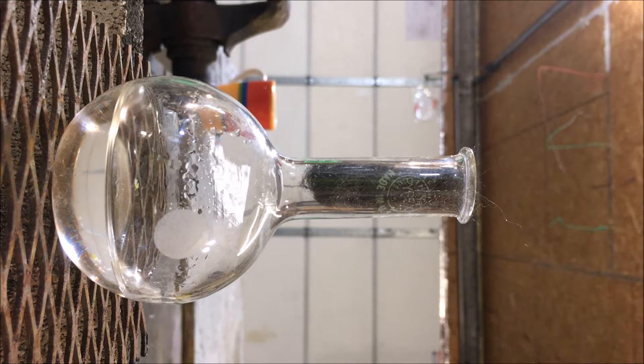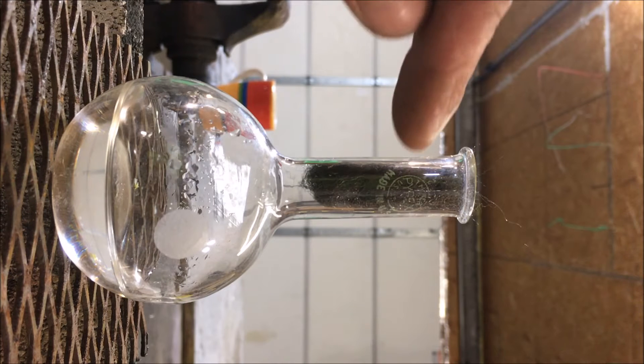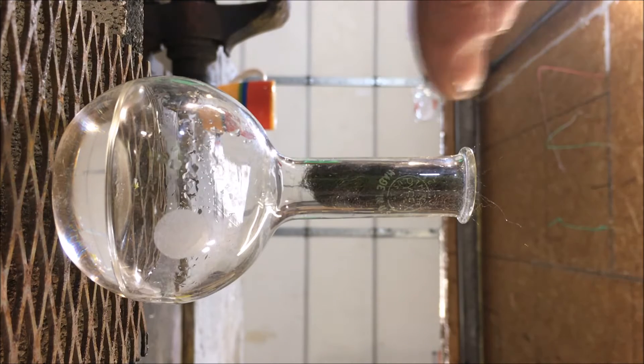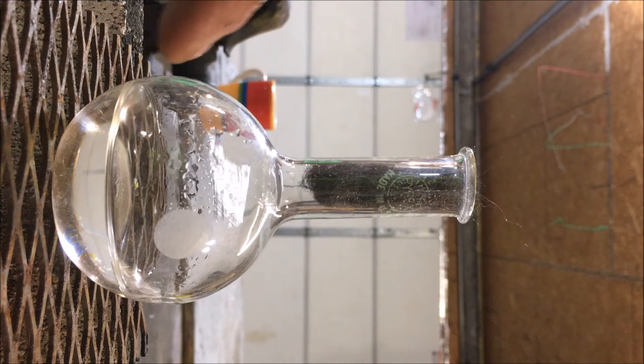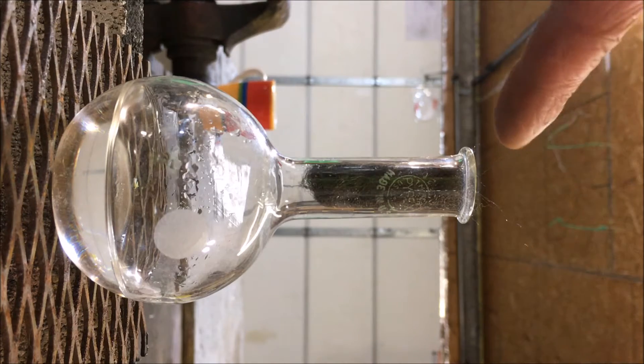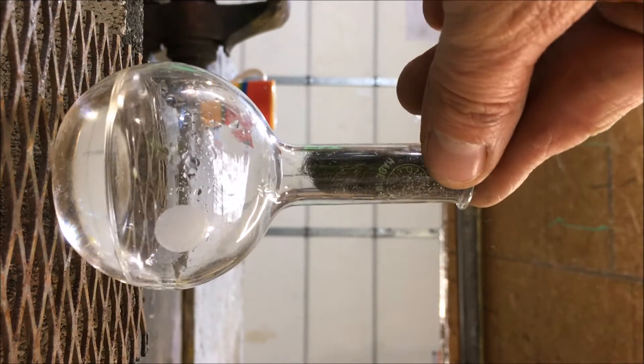This video is a quick test tube experiment to determine the plausibility of hydrogen production using an iron catalyst reaction. We're going to heat this iron wool up with the blowtorch until it gets red-hot, and as that's happening the water will start to boil in the flask. Some steam will contact the hot iron wool and we're going to try and see if we can get a little tiny hydrogen flame on the top of this thing here.